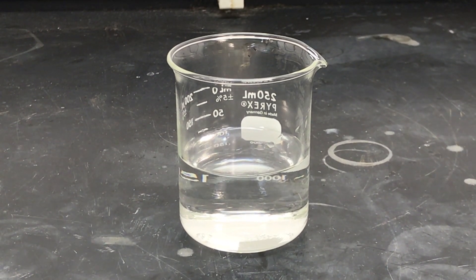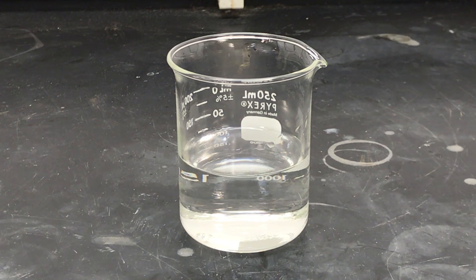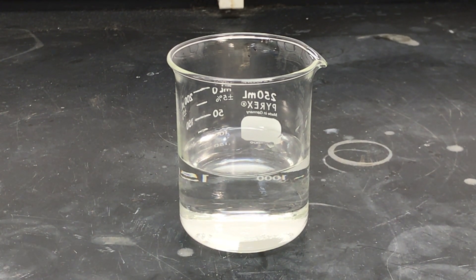I use tongs to get a piece of sodium. Next, I will drop the piece of sodium into the beaker with the deionized water. This is where you will want to make your observations on a piece of paper.